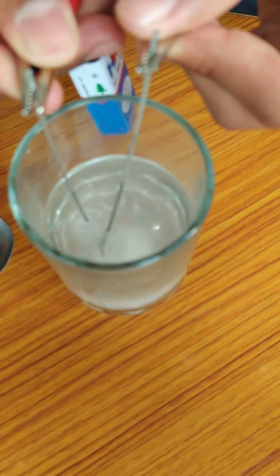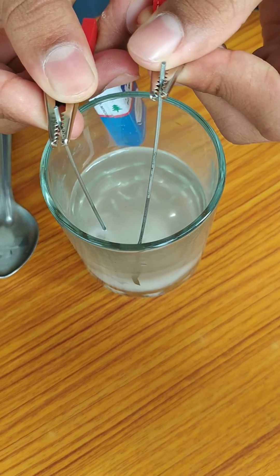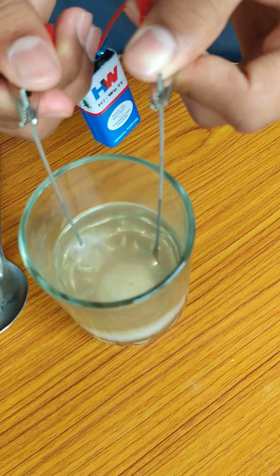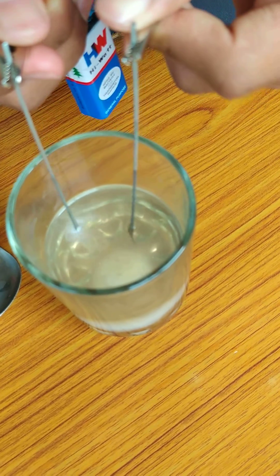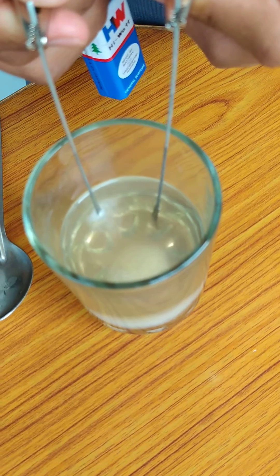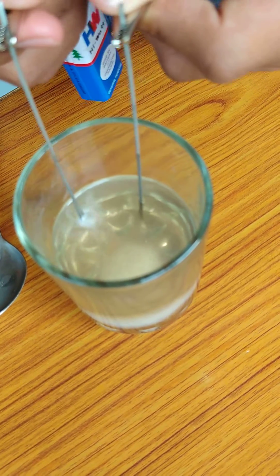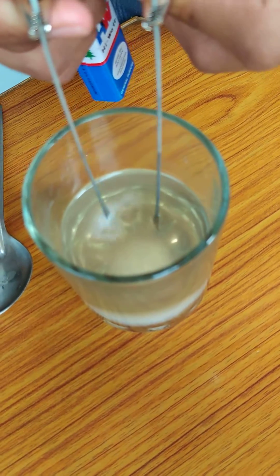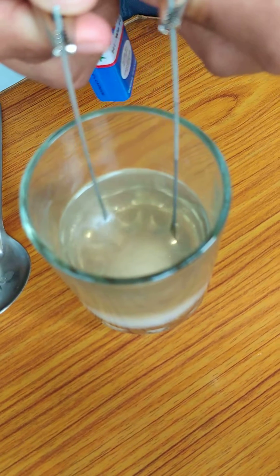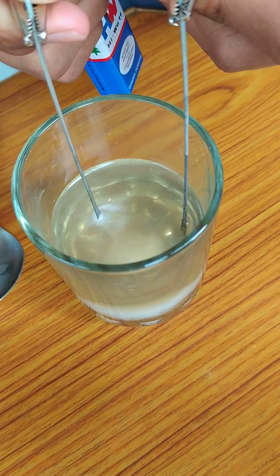Now, as we can see, at the anode, oxidation of chlorine is taking place. That is, the chloride ion is getting converted into chlorine gas by releasing an electron.